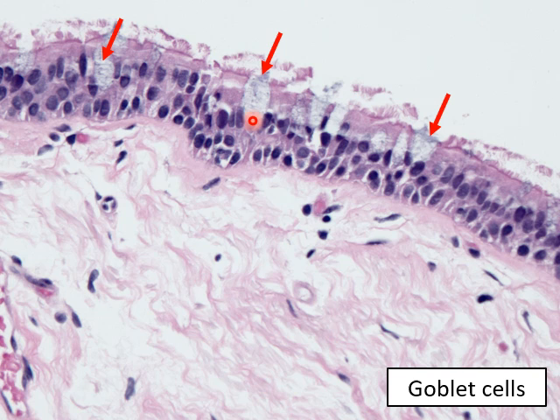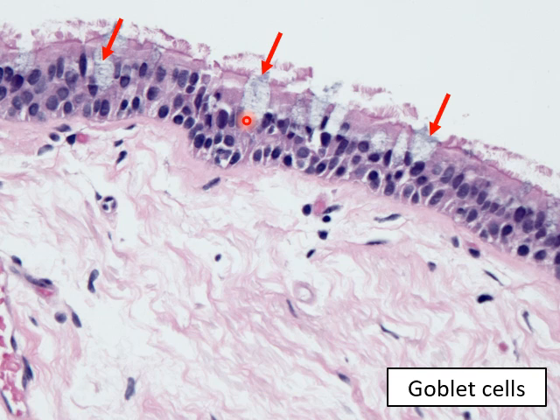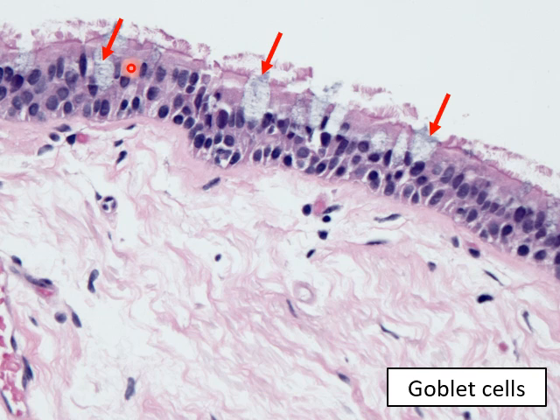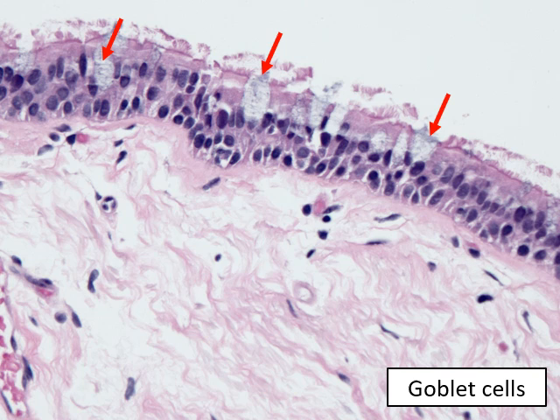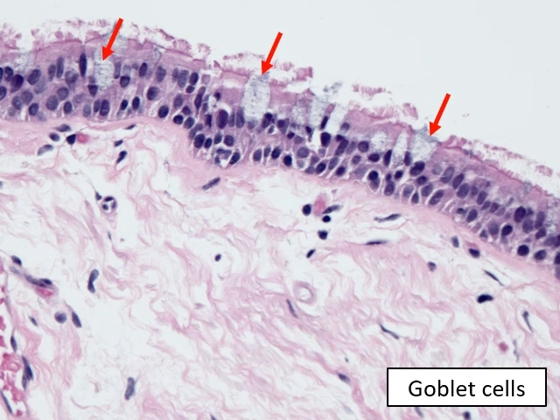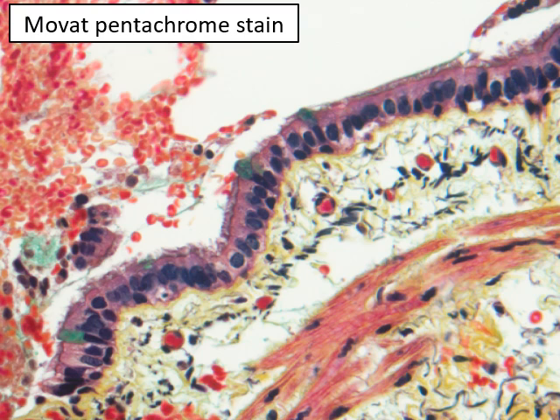The mucin-filled top gives the cell a goblet appearance — like a wine glass, where the pale mucin fills the top and the narrower stem is the lower portion. These goblet cells also produce mucin, but they contribute the minority of the mucin in the lumen. The majority of mucin comes from the submucosal glands deeper in the bronchial wall.